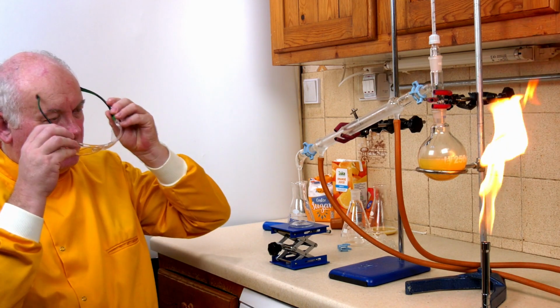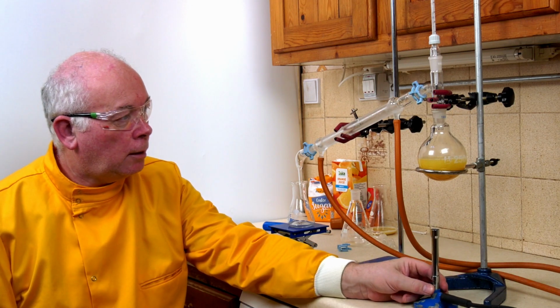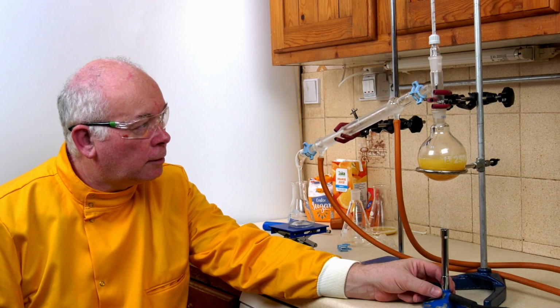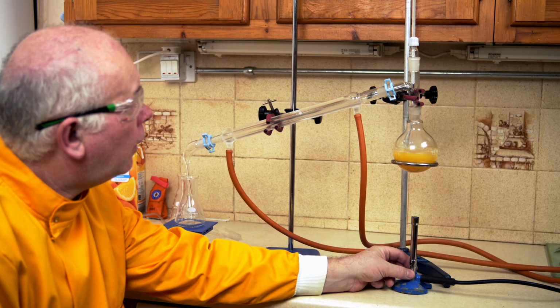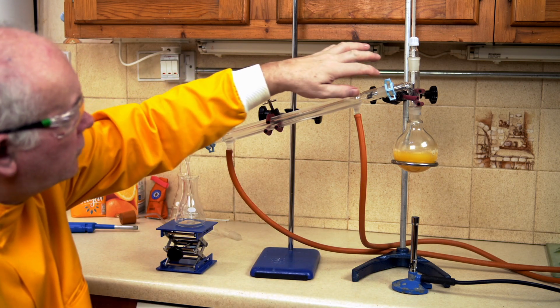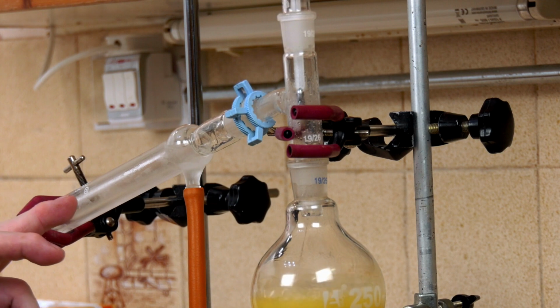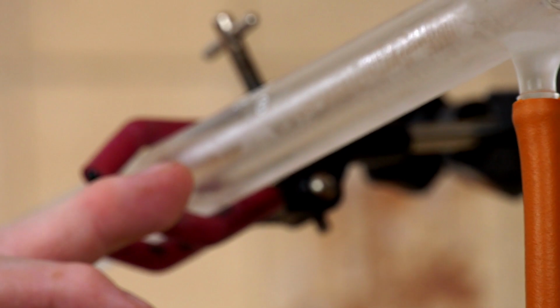I'll just put my safety specs on, and let's start heating up our alcohol mixture that we want to try and separate. So it's going to start gradually boiling, and what we can observe as this happens is we're getting some condensation up in this tube. And if you look here, you might see some gas just coming down.